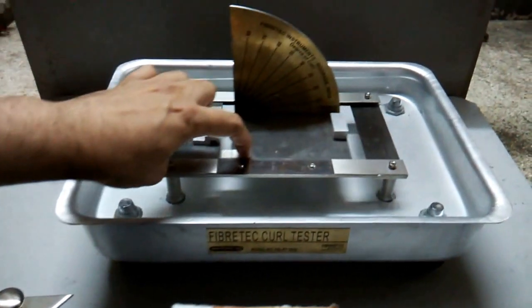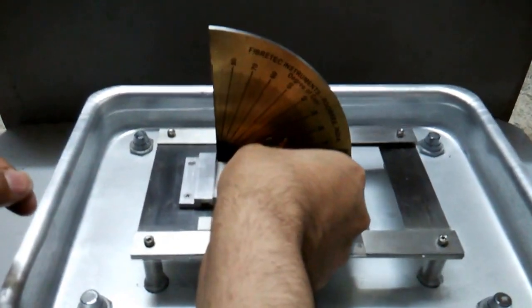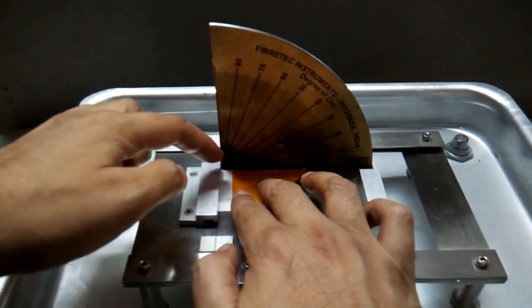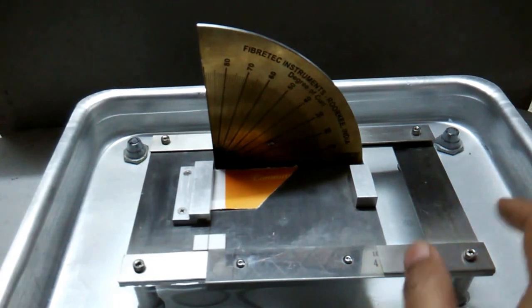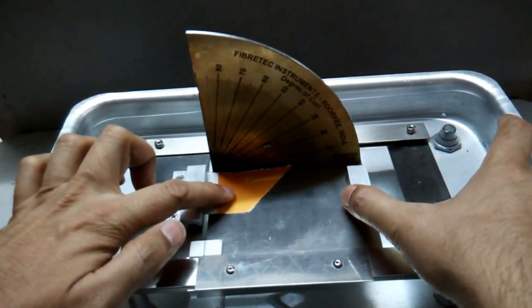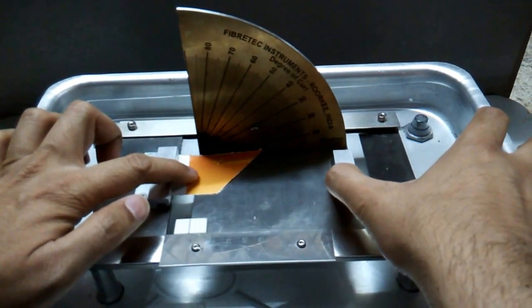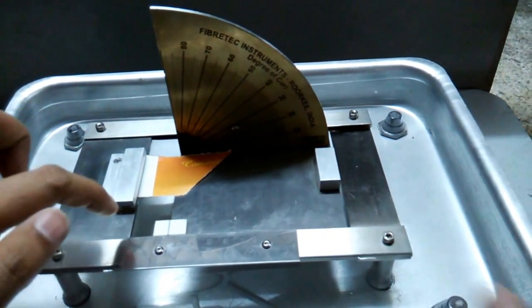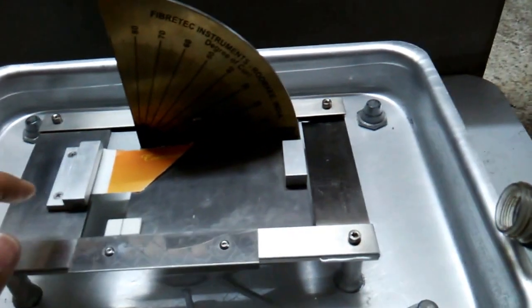The specimen is kept over here. You have to keep it a little bit away from the scale and maintain the aperture. You can see the level is not being raised until it reaches this surface.